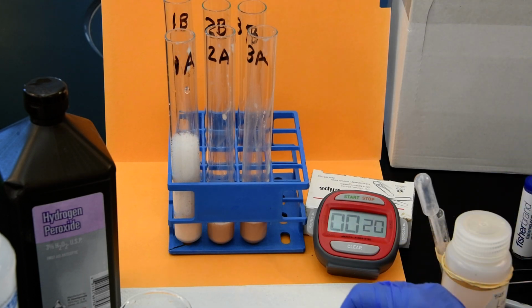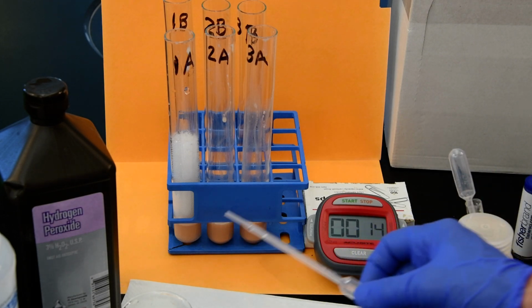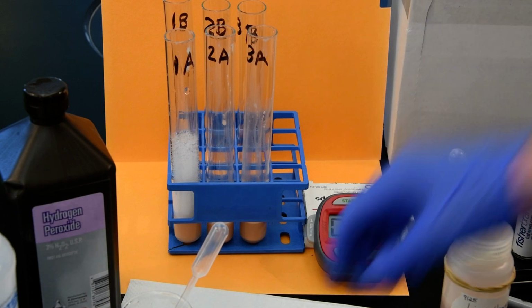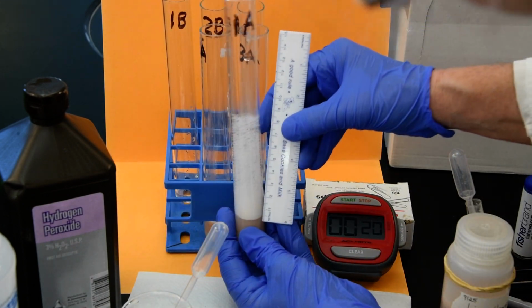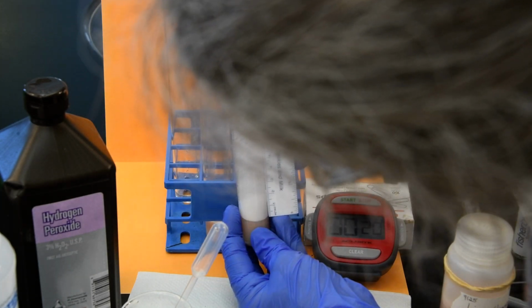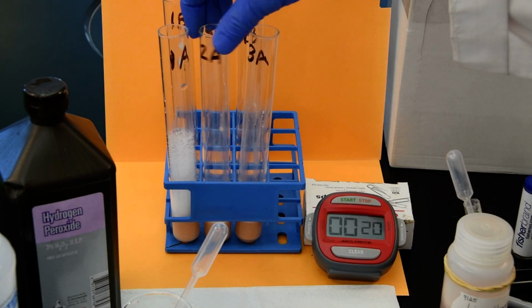All right. So, whoops, start. There's a little timing, since I didn't put my pipette back in. Hydrogen peroxide looks surprisingly like water. All righty, so when I measure the bubble column here, after 20 seconds, it appears to be at about 8.1 centimeters, or 81 millimeters. All right, so we'll do the next one.